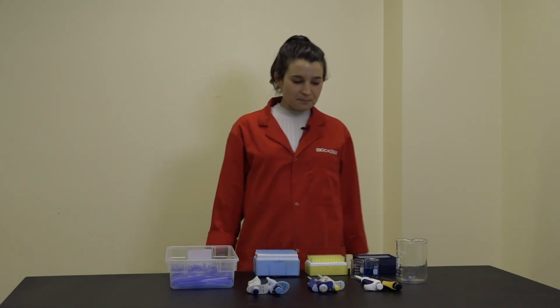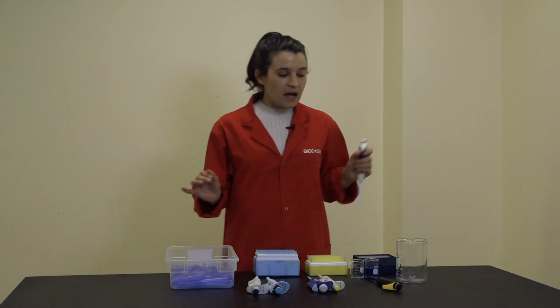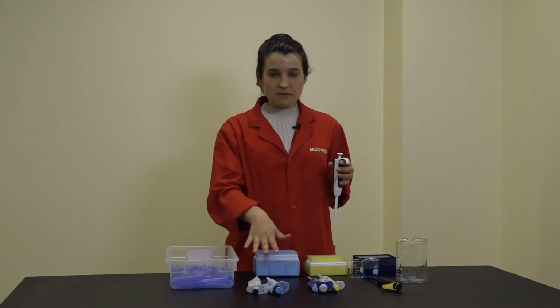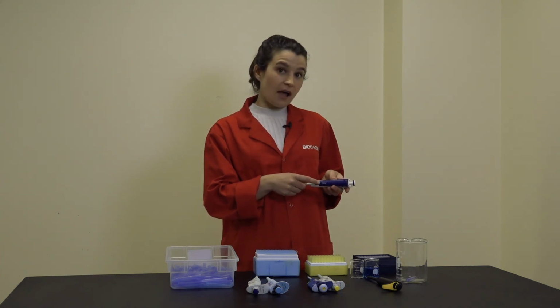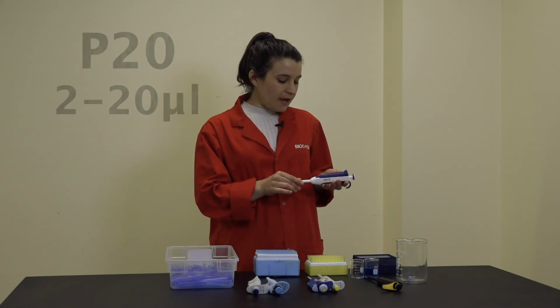Today I'm going to talk to you about how to correctly use a micropipette. Micropipettes are used to accurately dispense very small volumes of liquid. They come in a number of different volume ranges, which are typically indicated on the side or the top of the pipette. So here I have a P20.